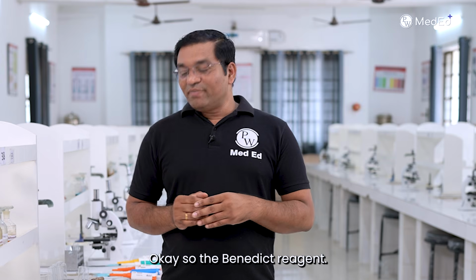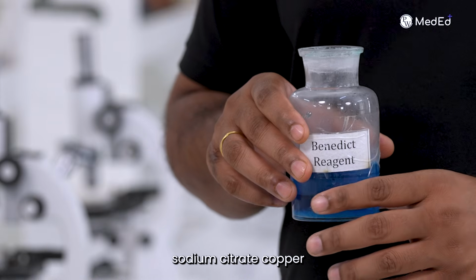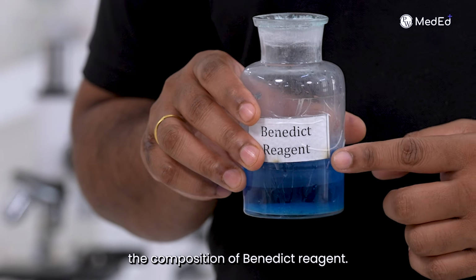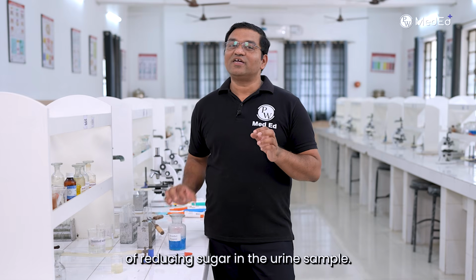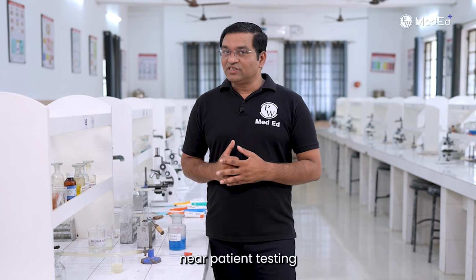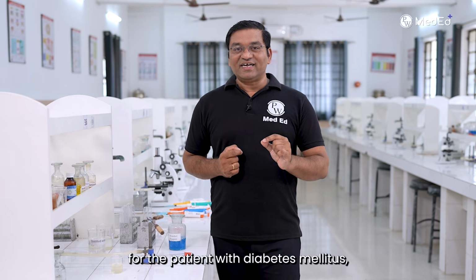Okay. So this is the Benedict reagent, which has sodium citrate, copper sulfate and sodium carbonate. So these are the composition of Benedict reagent. Now Benedict test is done for detection of reducing sugar in the urine sample. So this is also a point of care testing, near patient testing for the patient with diabetes mellitus.